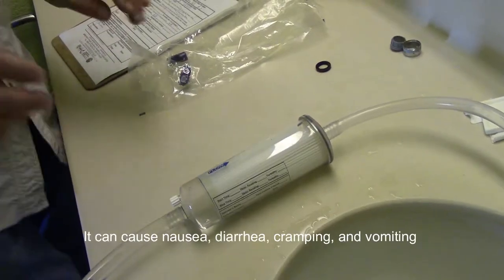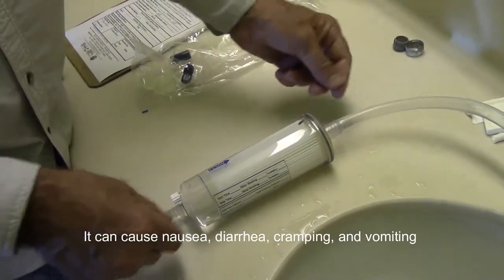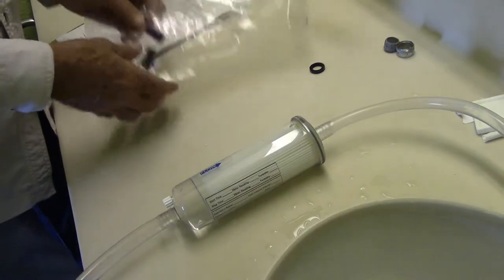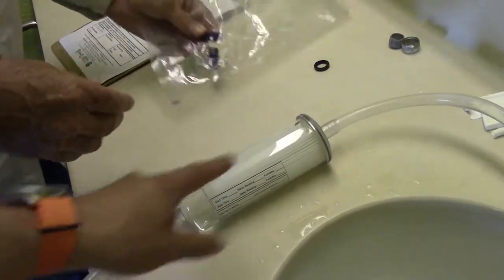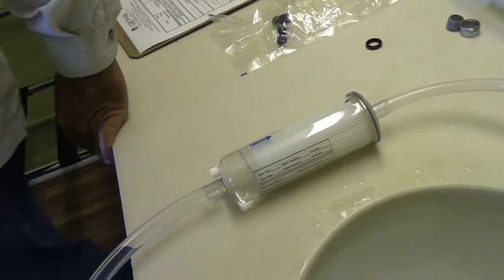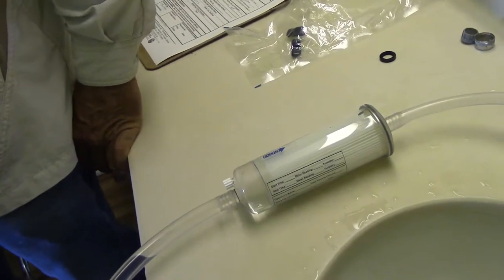And then I'm going to take this off, the tubes, shut it all down. Right. And these little caps, and then it seals it up. And then this is going to go in that insulated mailer.